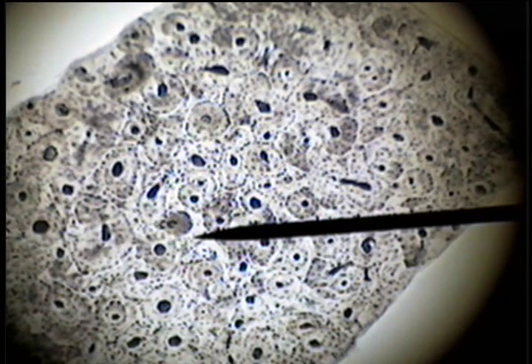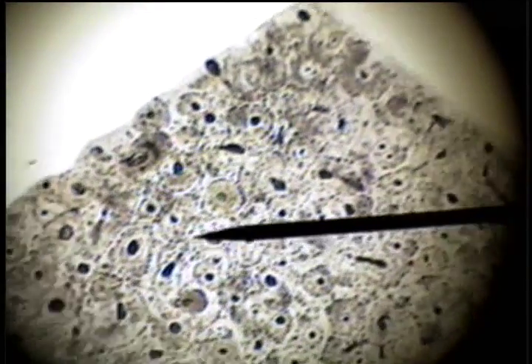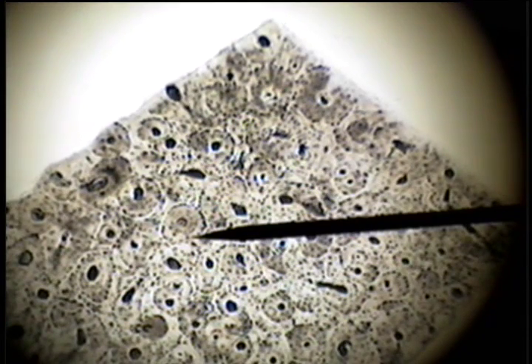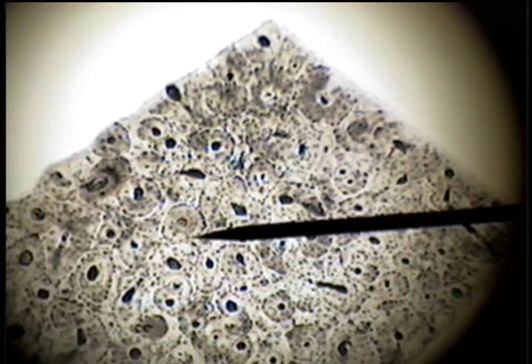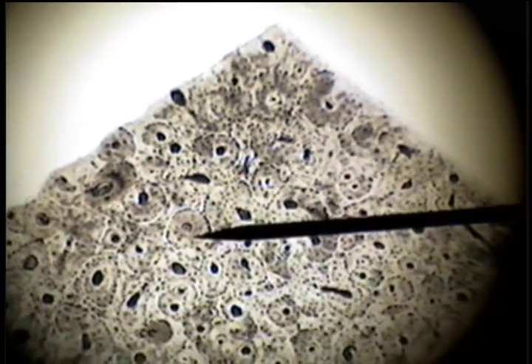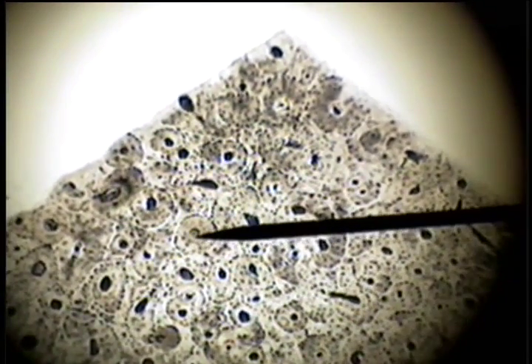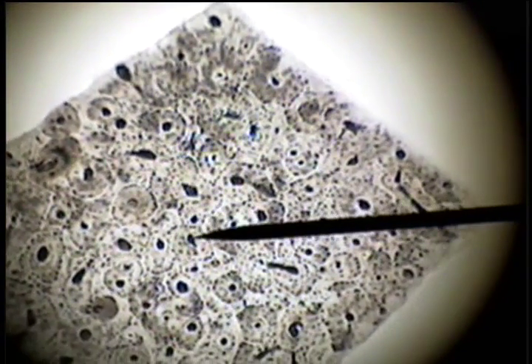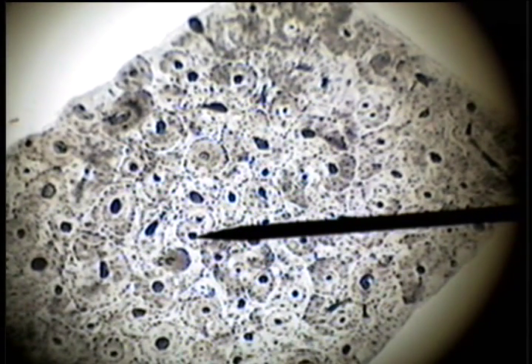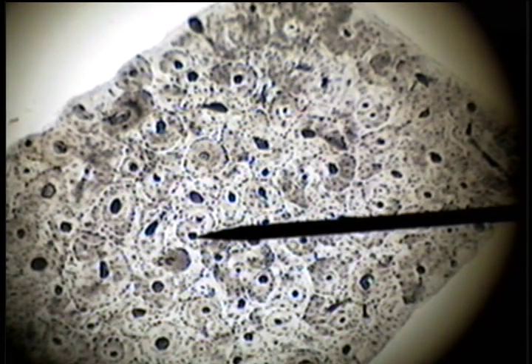This connective tissue is bone. It's characterized by these circular structures called osteon units. Each one of these is an osteon unit. And these osteon units have a dark center which is the grinding material filling the Haversian Canal. So this is the Haversian Canal.